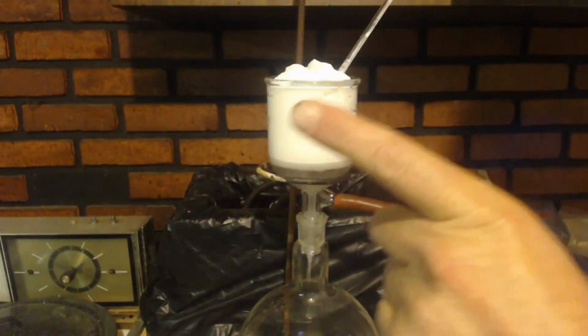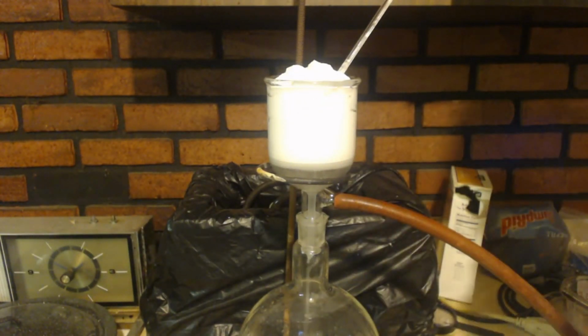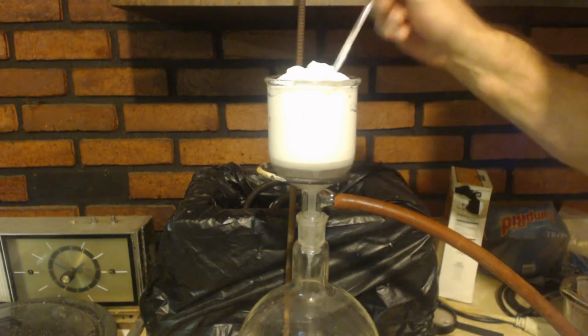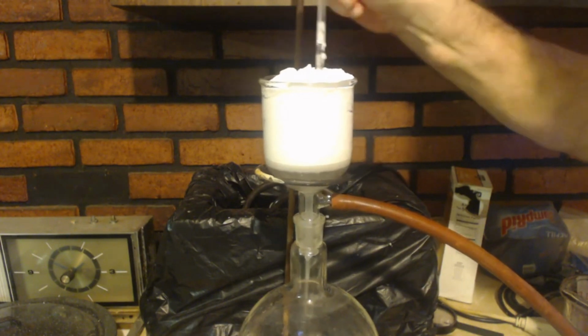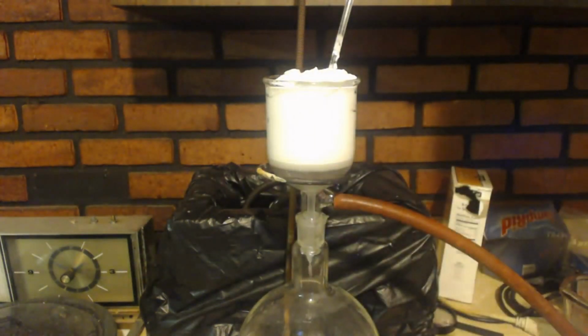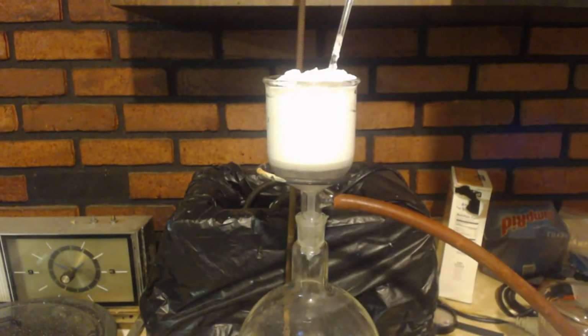Now I forgot to say, I did a pH of this water, and it is a pH of 1. Because you do want to have excess HCl, not excess sodium benzoate. Because HCl won't recrystallize in your product, whereas if you have a little bit of sodium benzoate, maybe it will a little bit. So I'll just add a little bit of water and put it in there. And I'm going to pour this liter of cold water through here as I stir it up and wash it to get the sodium chloride out of there and get that excess HCl.